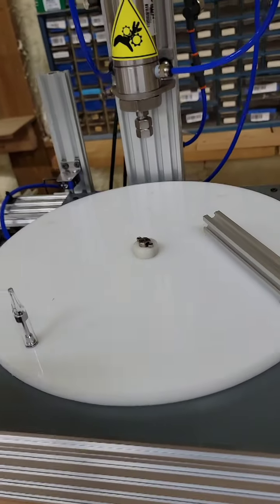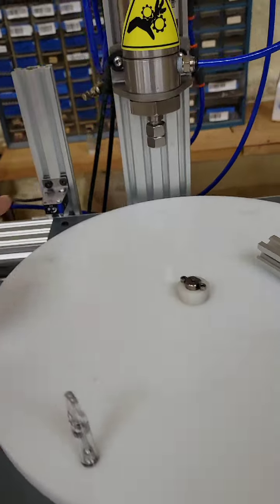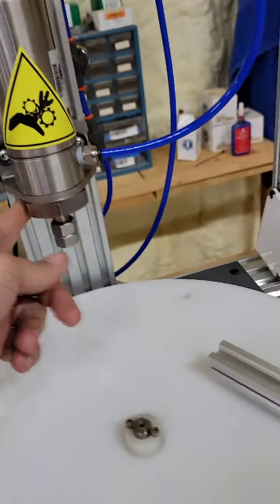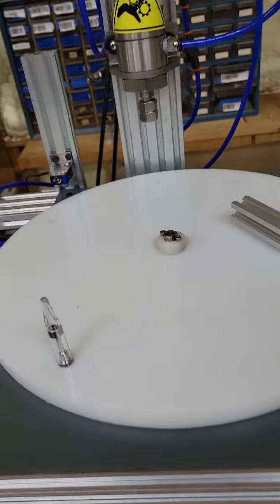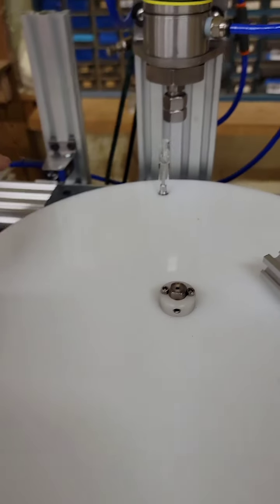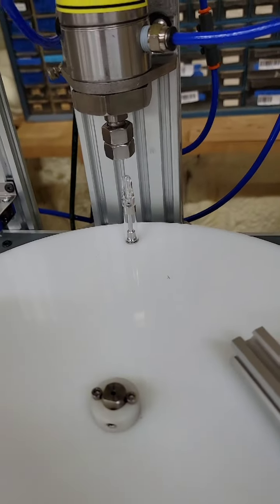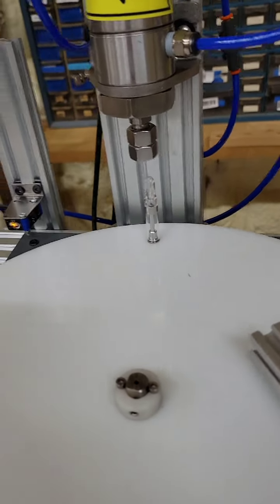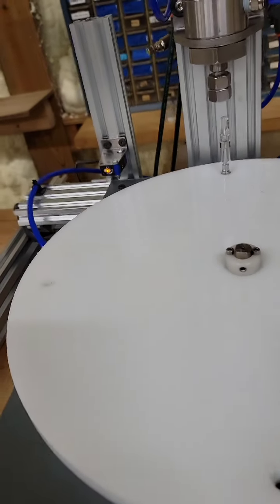But as far as the capper, there's really no variables except where the eye is, which is manually controlled, and pressure for the piston over here. As far as everything else goes, you hit your foot pedal, your eye's going to see it, then it's going to go down, it's then going to go up, and that's it. So there's really nothing to control.